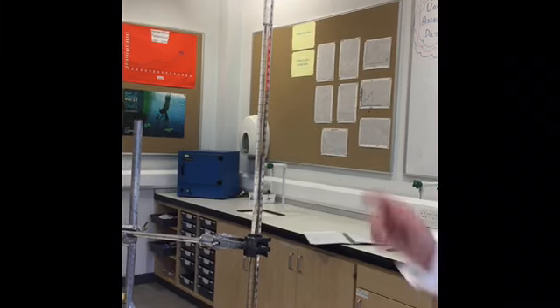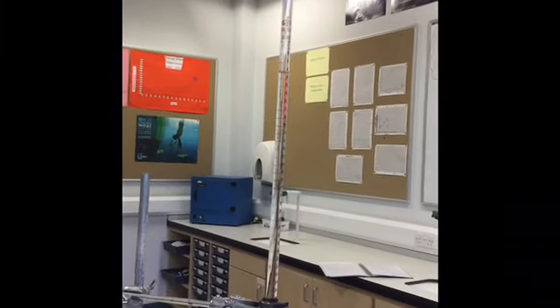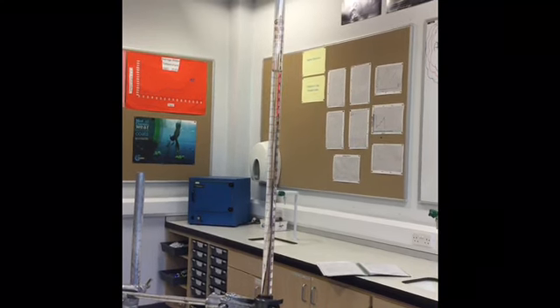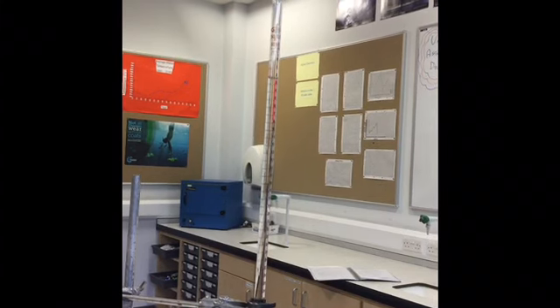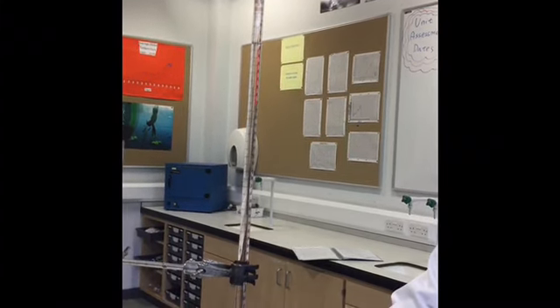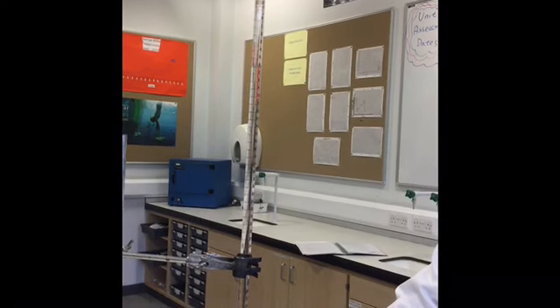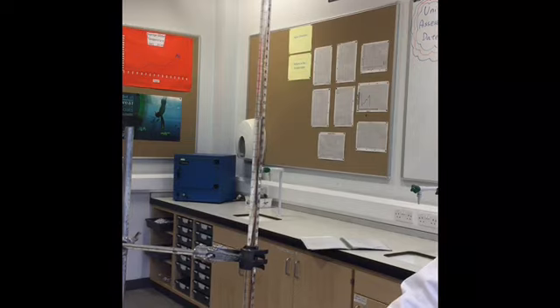Okay so I've already recorded our starting volume which is 2.2 cubic centimetres. The instructions tell you to add approximately 15 cubic centimetres of the EDTA, so I'll take it down to about 17. We started at 2 so going down to 17 is approximately 15.